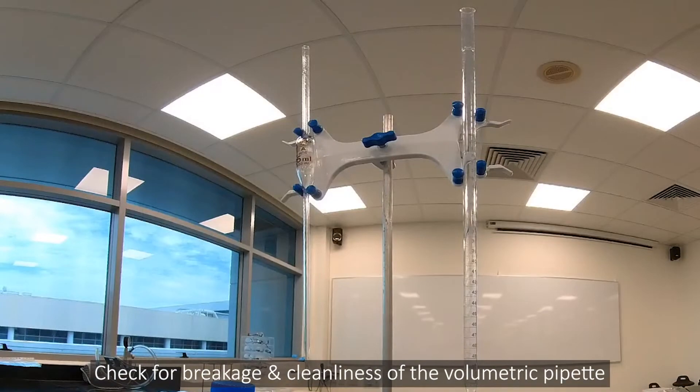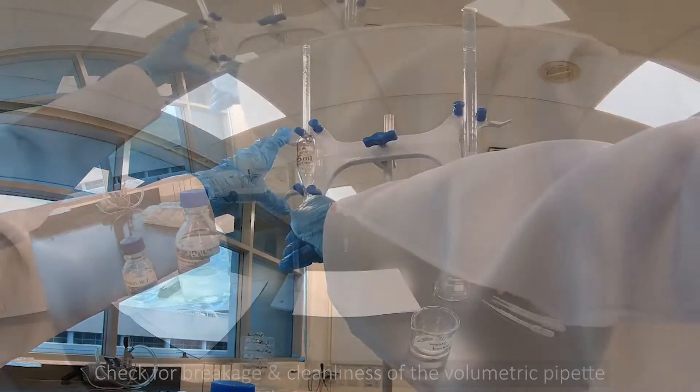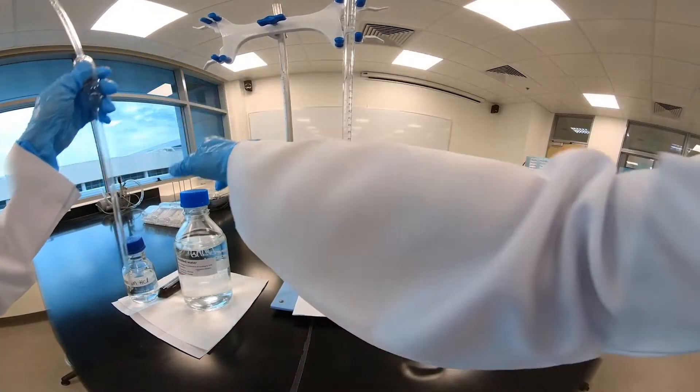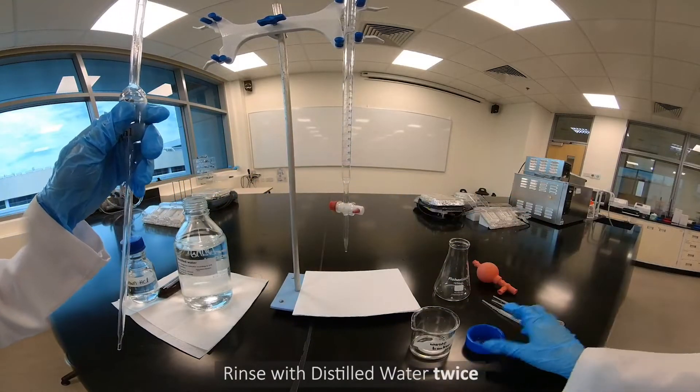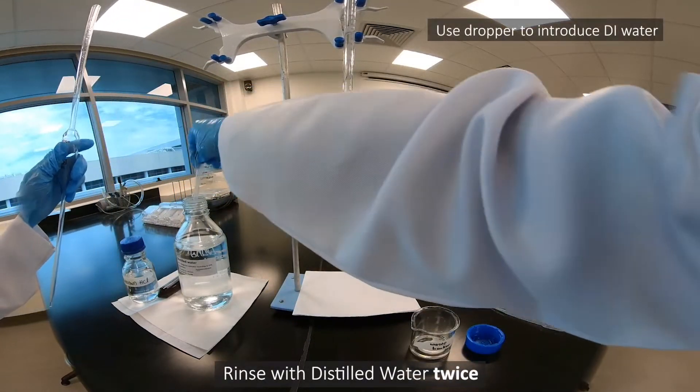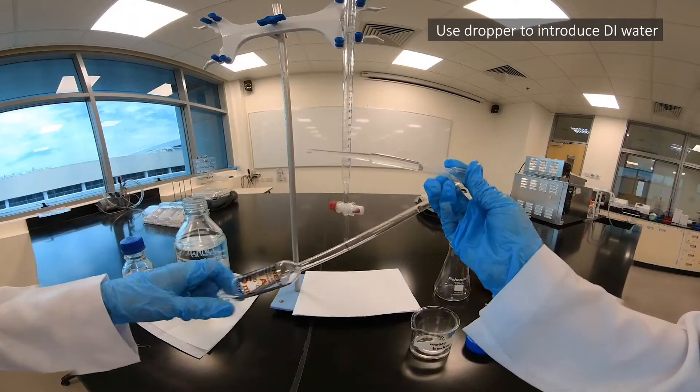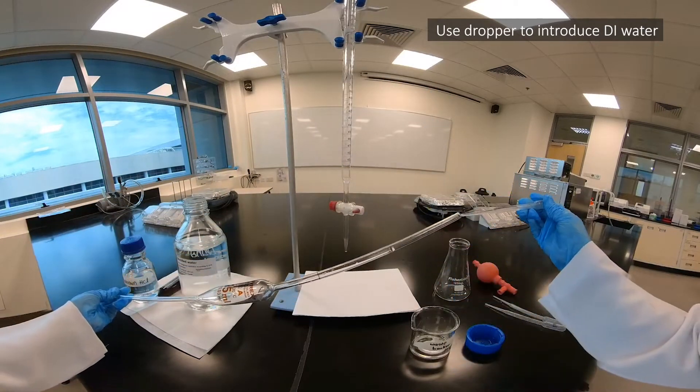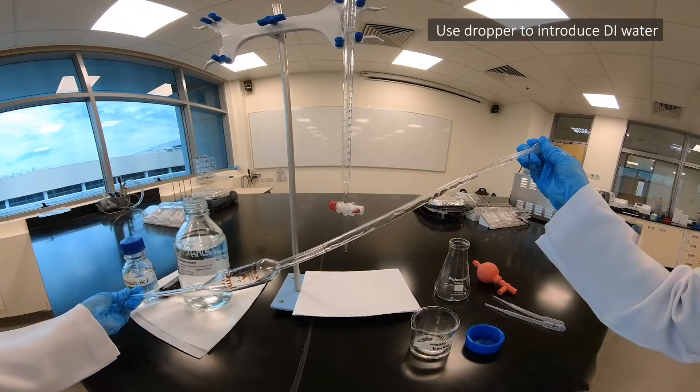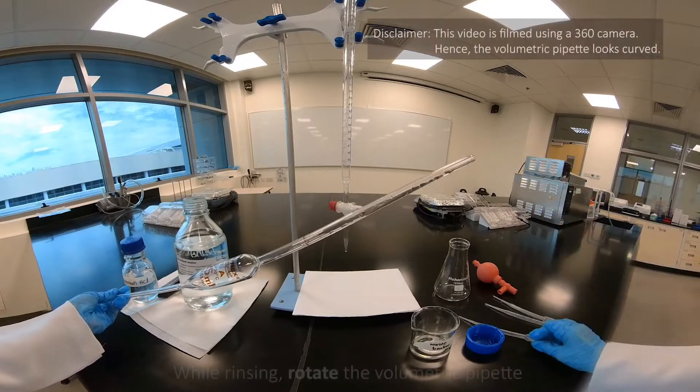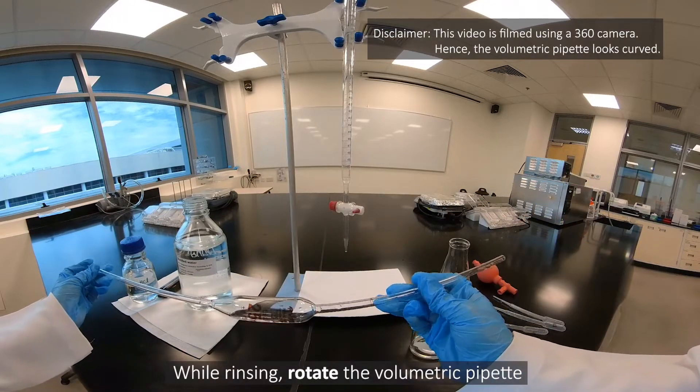Check for breakage and cleanliness of the volumetric pipette. Rinse with distilled water twice while rotating the volumetric pipette.